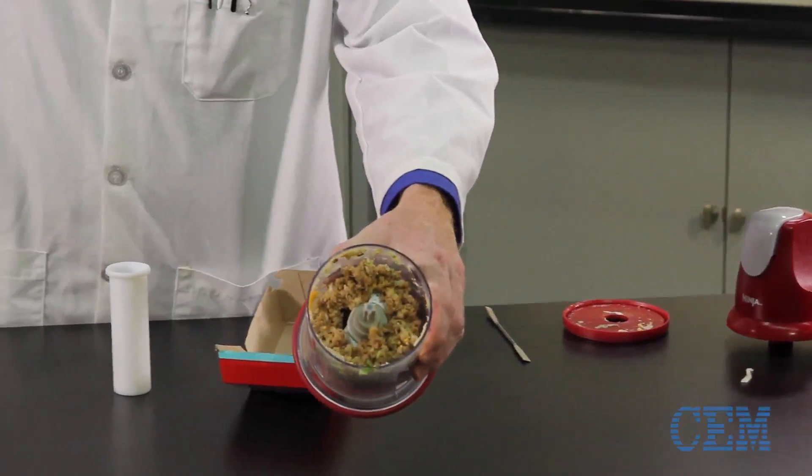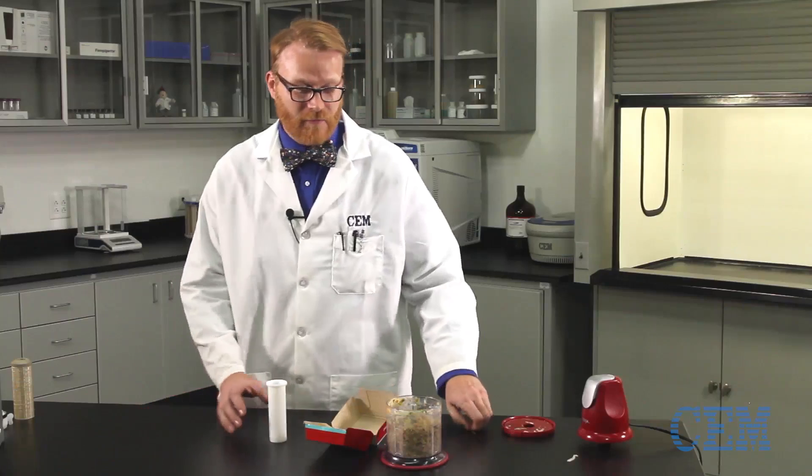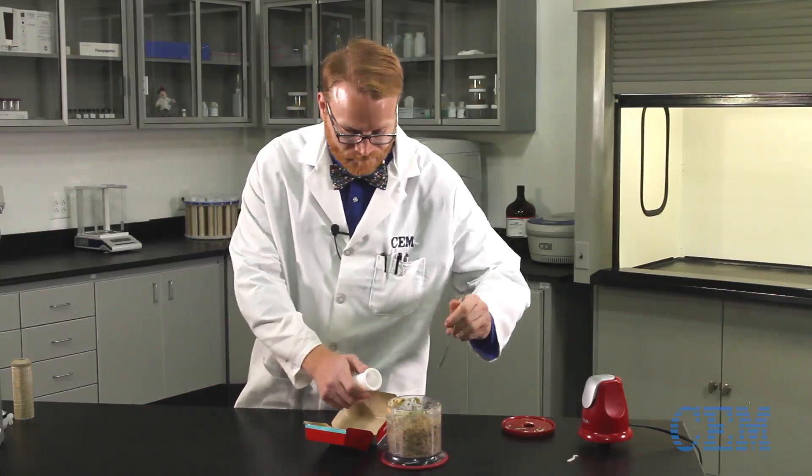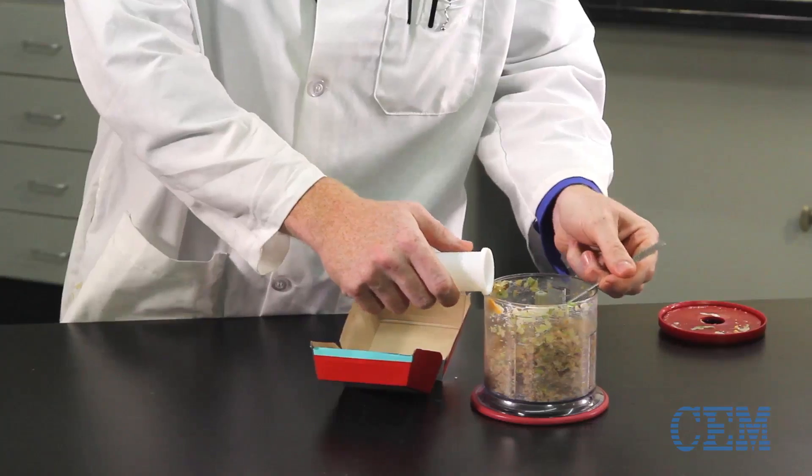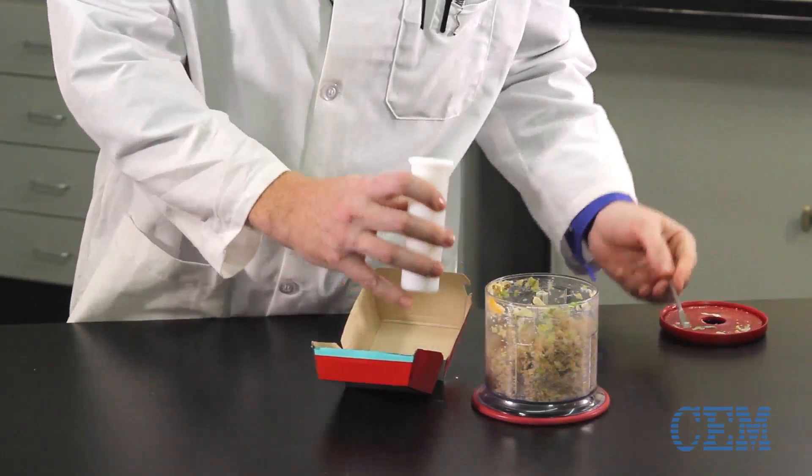Now that we have a homogenous mixture, we're going to get a representative sample into our vessel. There we go.